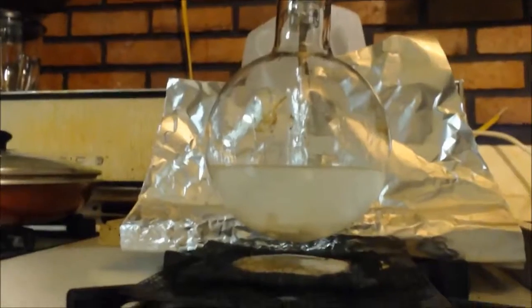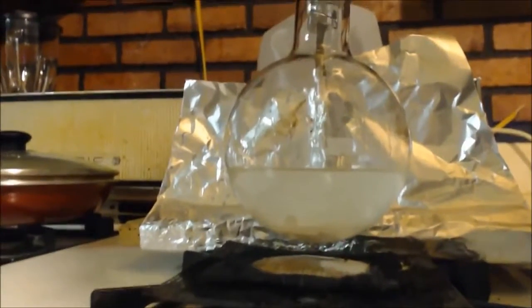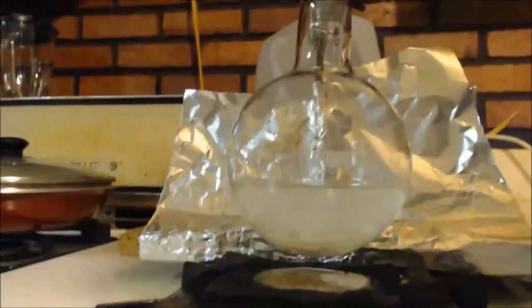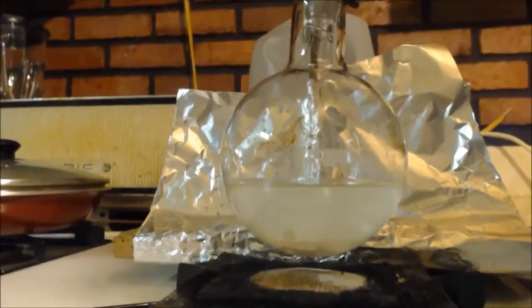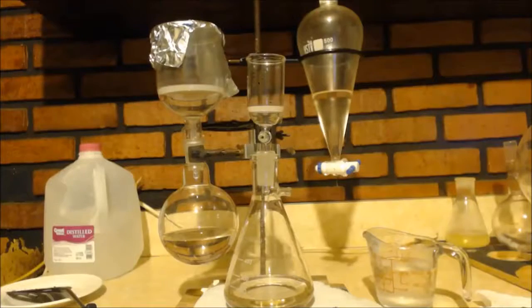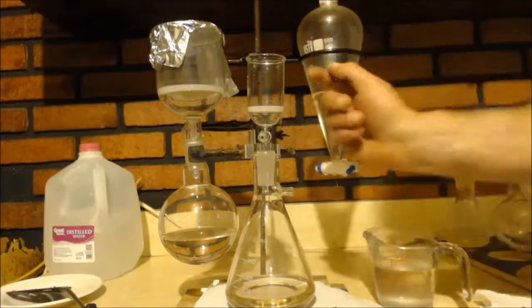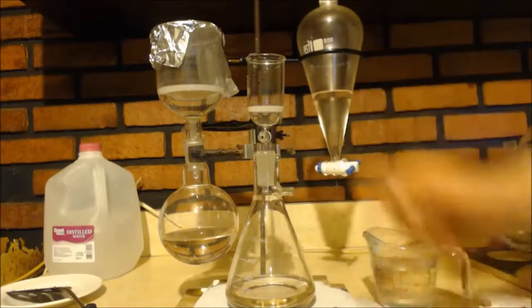Probably can't see it. But there's salt. That's the pot. That's all the sulfuric acid. There's boiling stones in there that are white. But there's also white salt. So, I don't know if drain cleaners have, you know like sulfuric acid, they have corrosion inhibitors in them. So maybe it's a salt, some type of salt or whatever. And you can see this. This is the sulfuric acid that was left in the pot. I filtered it. But it wasn't, it was just like a fine dusting there. I'm not even going to collect it.